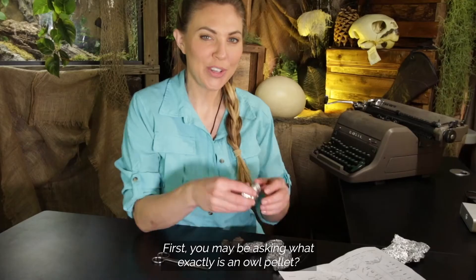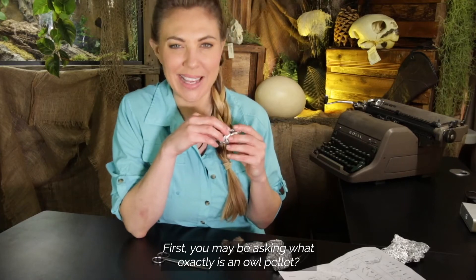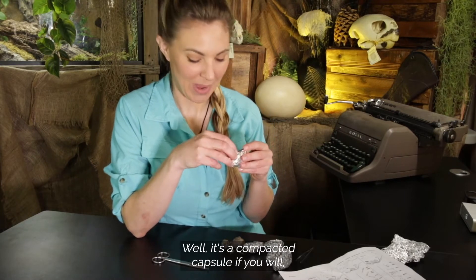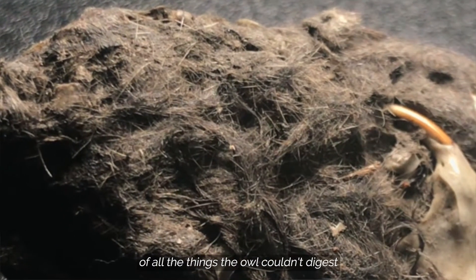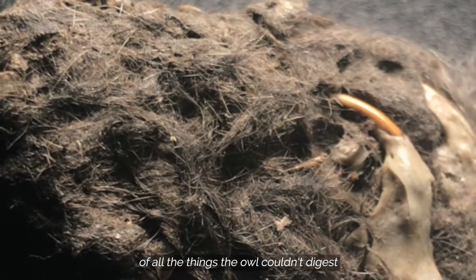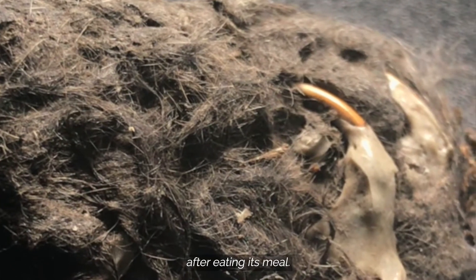First, you may be asking: what exactly is an owl pellet? Well, it's a compacted capsule of all the things the owl couldn't digest after eating its meal.